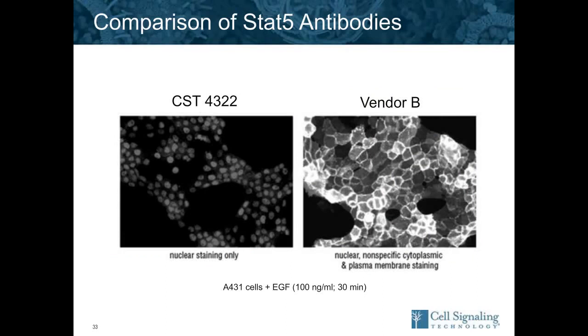And so what you see here on the left is nice nuclear stain like you would expect for phospho-STAT5. But on the right, that's clearly indicative of a membrane protein, most likely EGFR in this case. So this antibody appears to be cross-reacting. This antibody is sold primarily for flow cytometry. So someone doing an experiment with this might not know that this antibody is not specific.